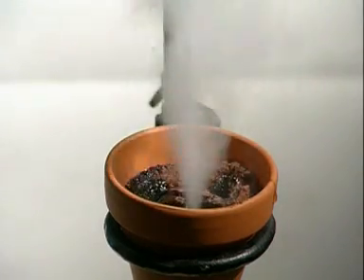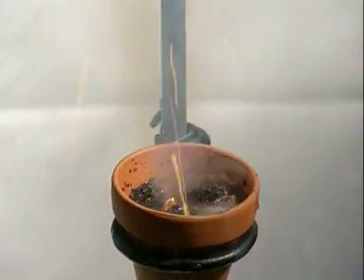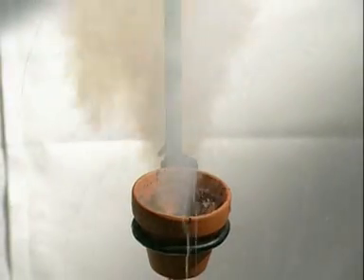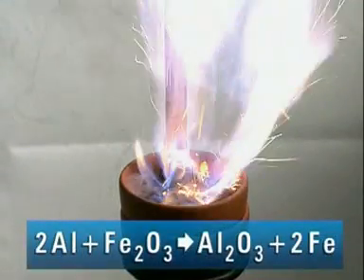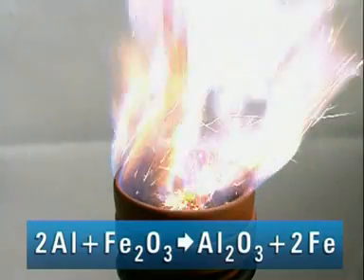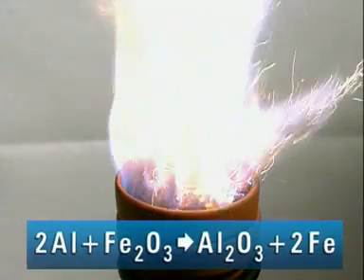The vigorous reaction between potassium permanganate and glycerol gives out enough heat to start the main reaction. Red-hot molten iron falls into the bucket. The aluminium has reacted with the oxygen in the iron oxide, leaving iron metal behind. So aluminium must be more reactive than iron.